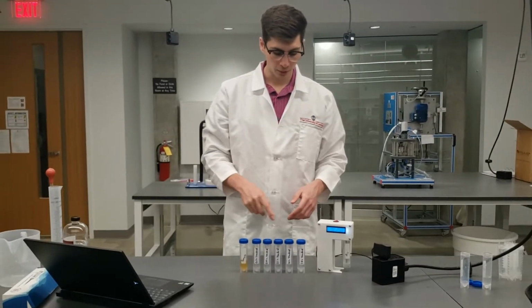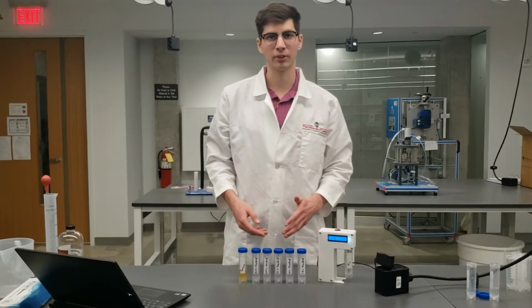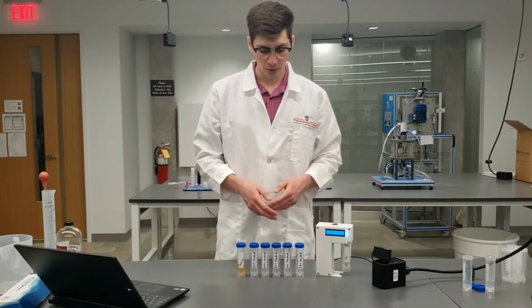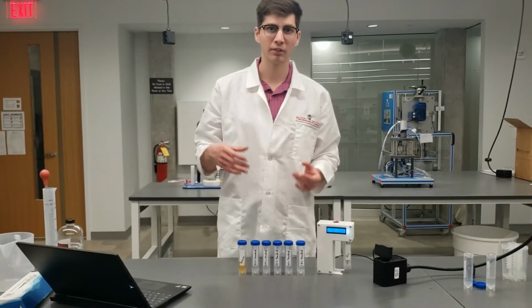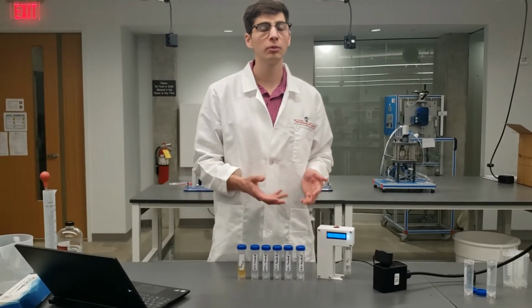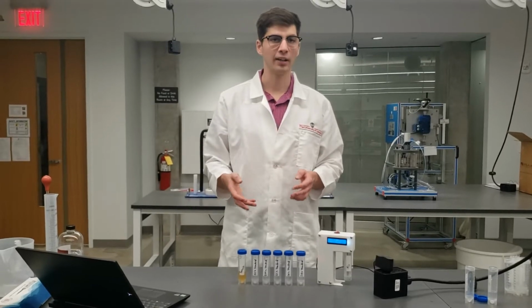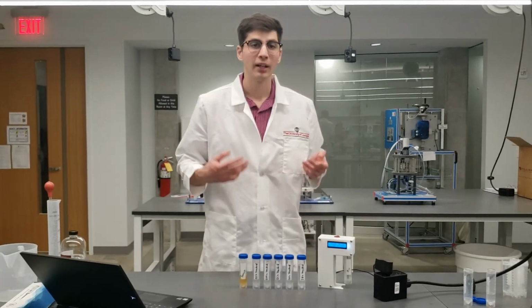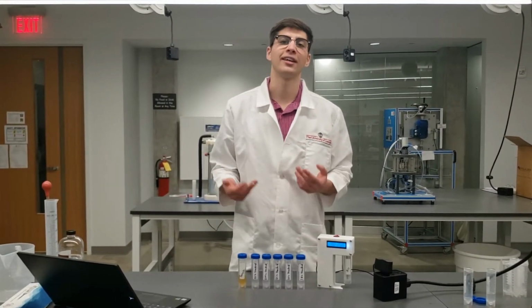So a few things to note is that you can see I have a relatively small volume of all of these samples that I want to run. Ideally, like I mentioned in the dilution video, you have a large stock of these standards in a fridge, and then whenever you need to calibrate the detector, which should be ideally every time that you use it, but worst case, you're at the very least using the same calibration temperature. However, for the sake of this video, I have small volumes of these standards just for the sake of demonstration purposes.